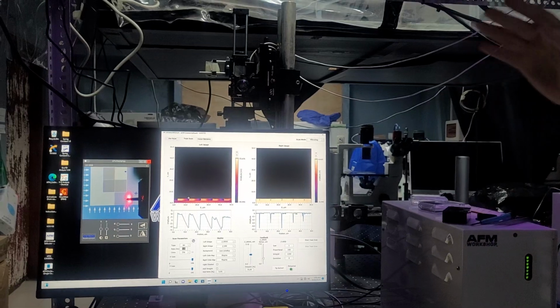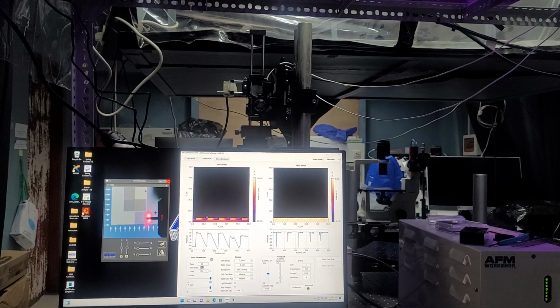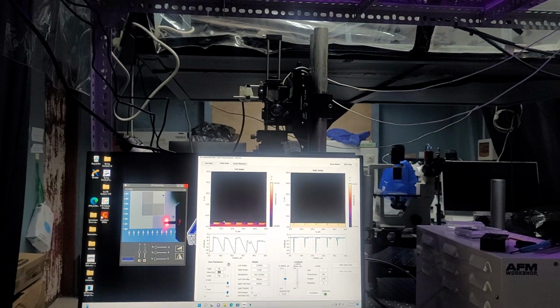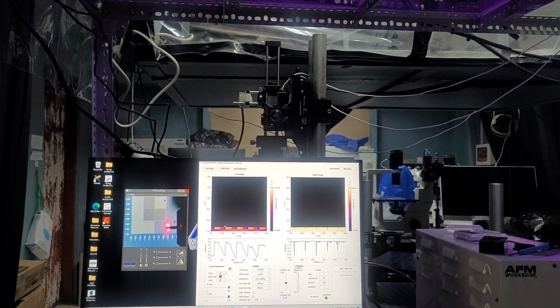The higher you ramp up that speed, the more chance that your ZGPIDs or your feedback system are not aligned properly for the speed that you're scanning, and you can break your tip. So I just recommend leaving it at 0.5 or slowing it down if you need a slower, nicer looking scan.